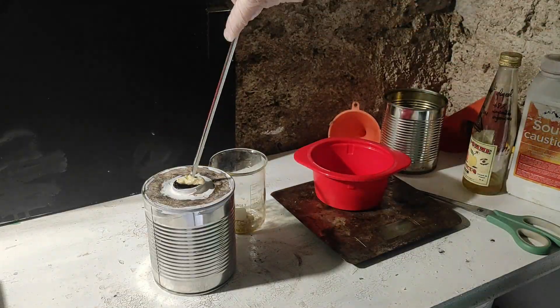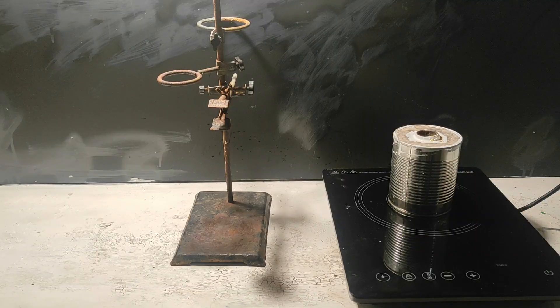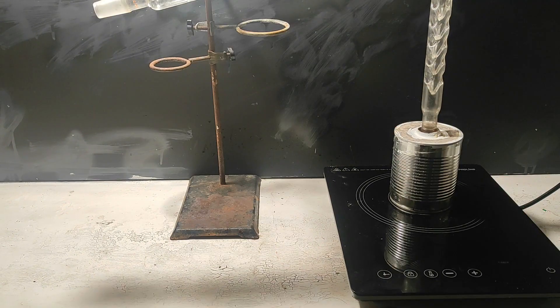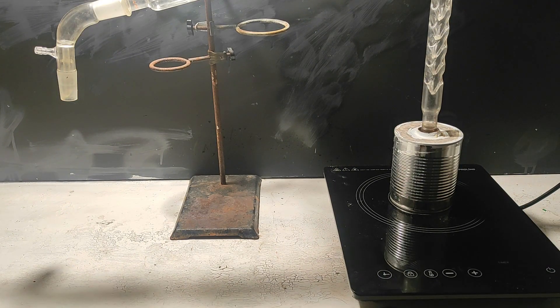Normally, we should do a reflux setup to heat the mixture at maximum, but since I don't have a water pump, I just made a distillation setup, because anyway, my hot plate will not boil all of the ethylene glycol, since it's not powerful enough.